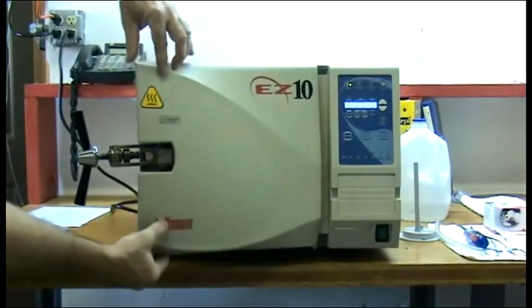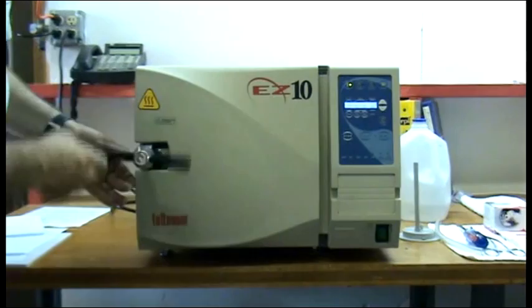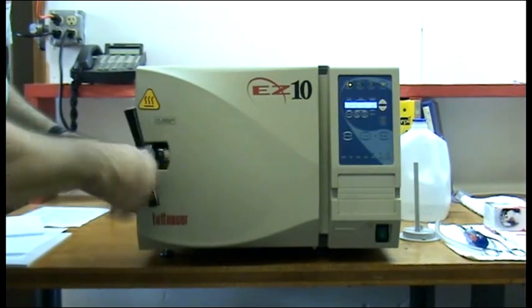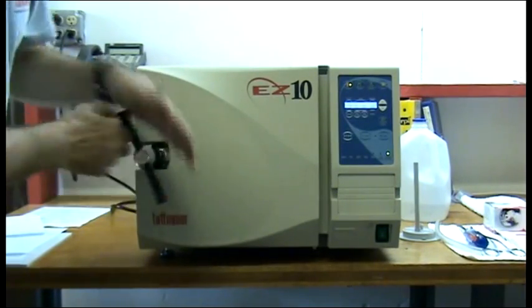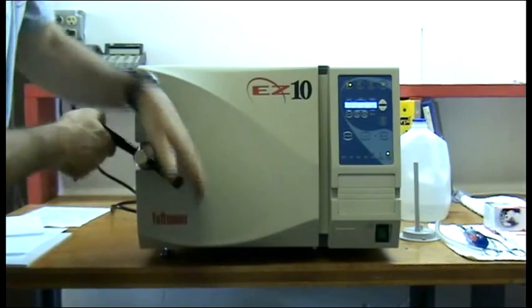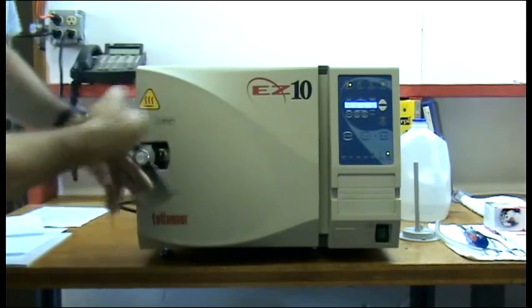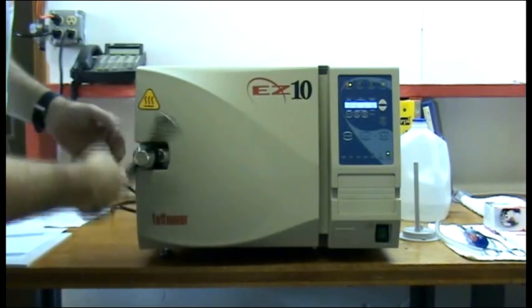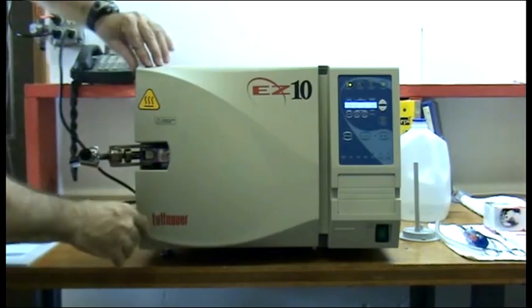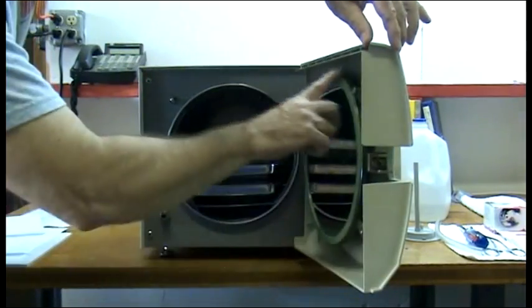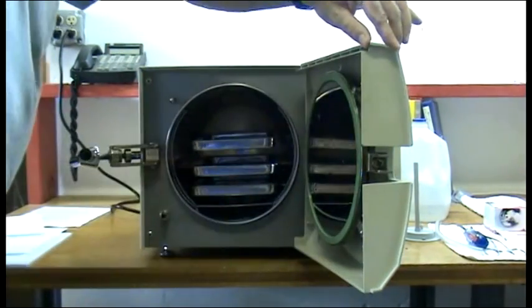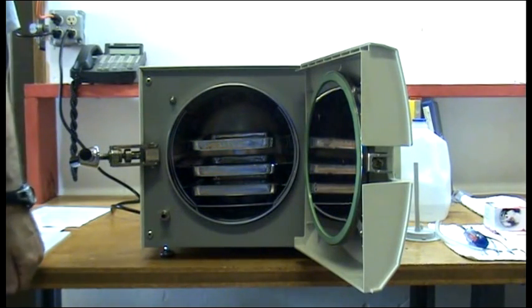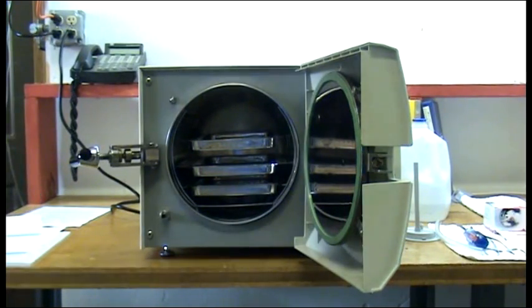Final step: close the door and tighten your gasket, which will help to seat it. After it's been closed, it will be even and you'll be ready for your next batch of processing.